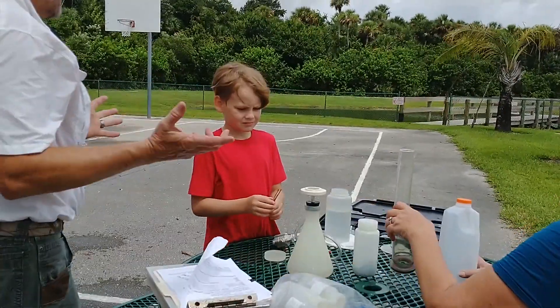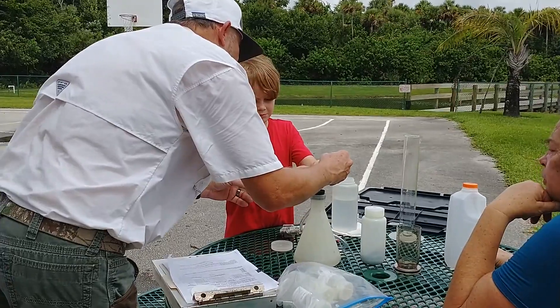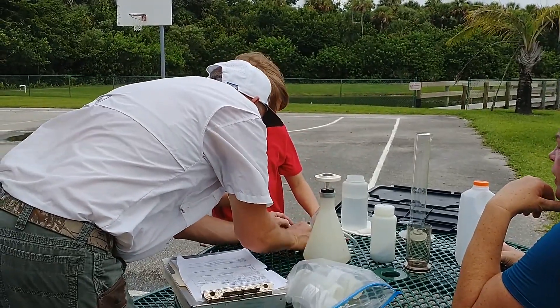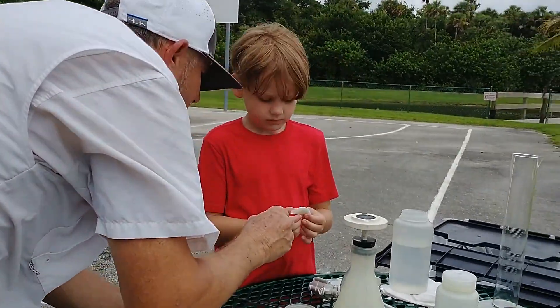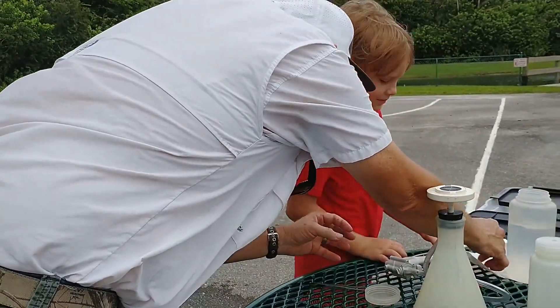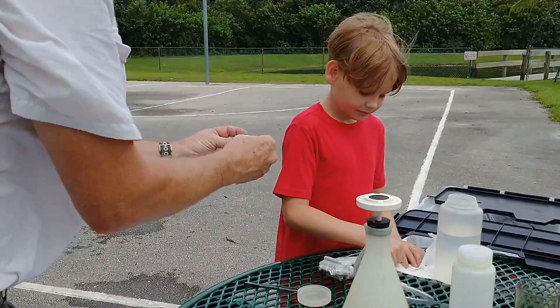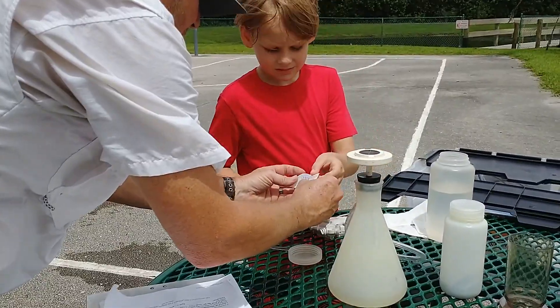Now it's taco time. Find the opening — you want to get right on the edge so you can close it right up. Pull it off, put your finger behind it with your other hand. Hold it like a taco. Take this, blot it dry — put it right there and blot it. Slide it right in there — slide it in the big taco. There you go, now it's all protected.